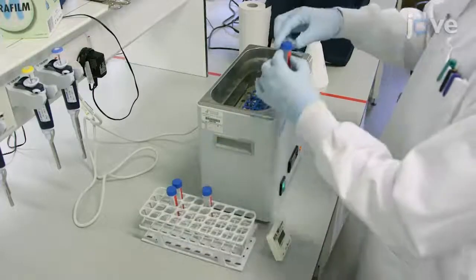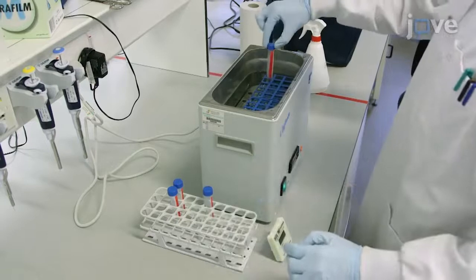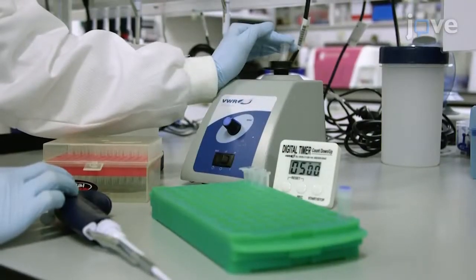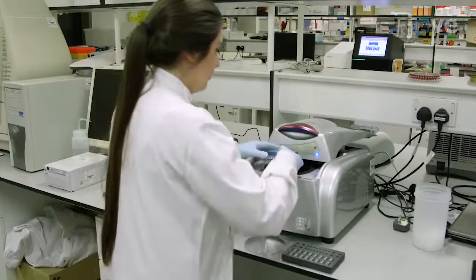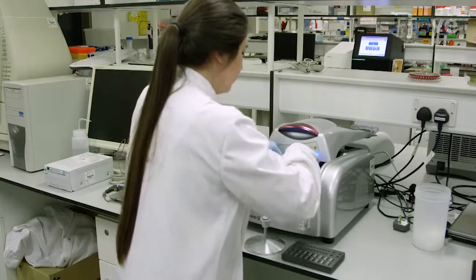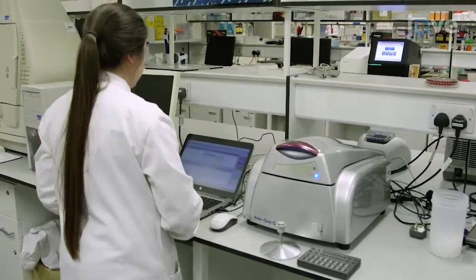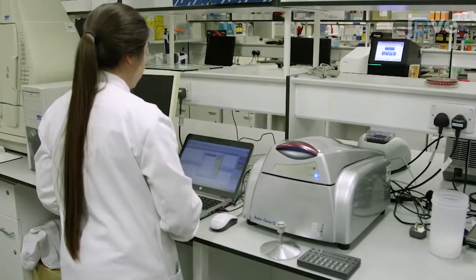This assay produces a quantitative result of the patient's tuberculosis burden and measures how this burden changes with treatment in a short time. With modification, this methodology can be applied to other bacterial pathogens. We have already developed similar technology for diagnosis of non-tuberculous mycobacteria and bacteria associated with chronic obstructive pulmonary disease.